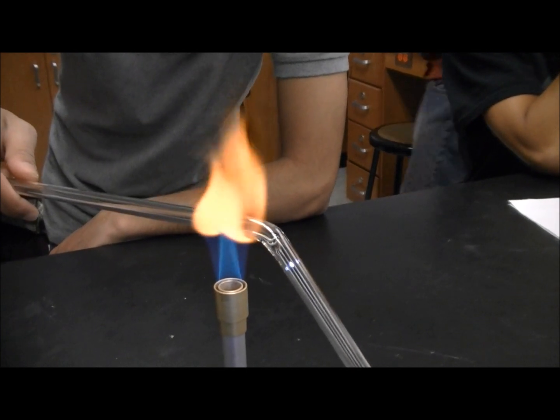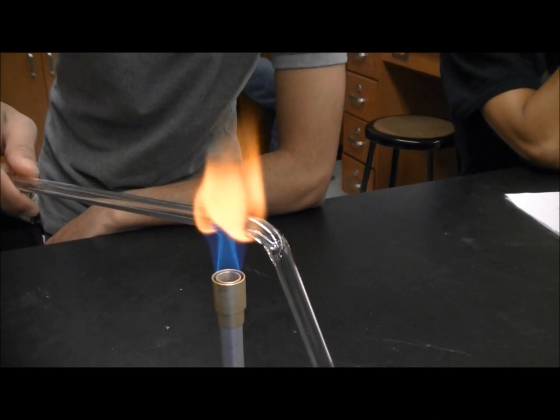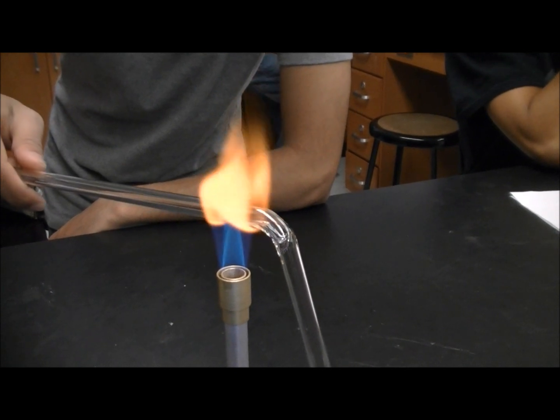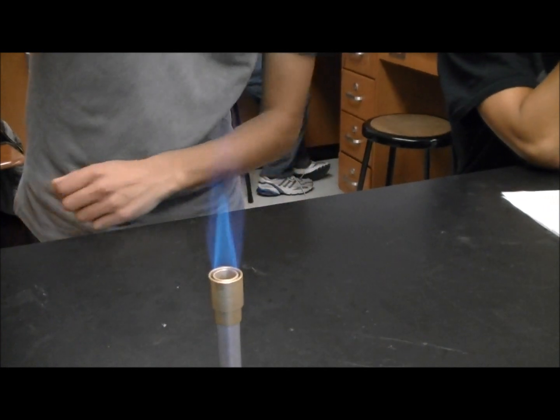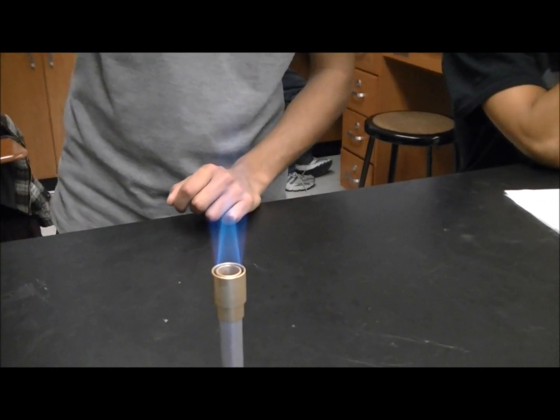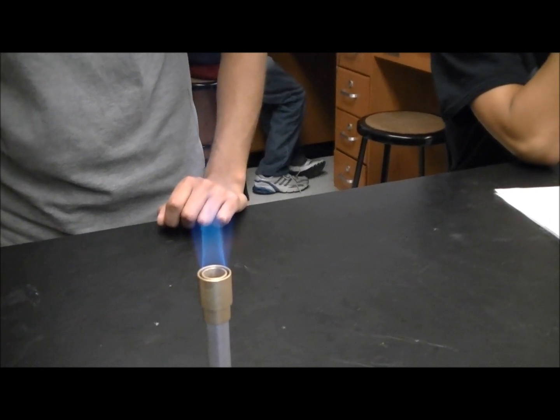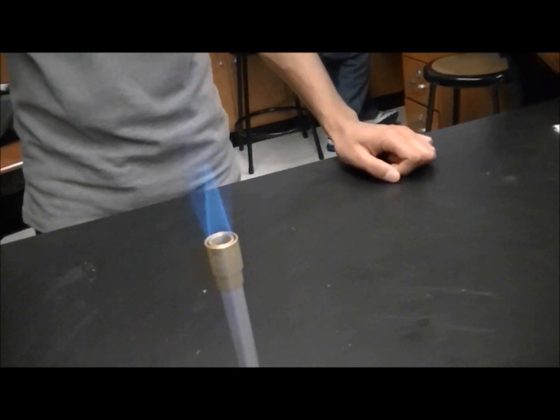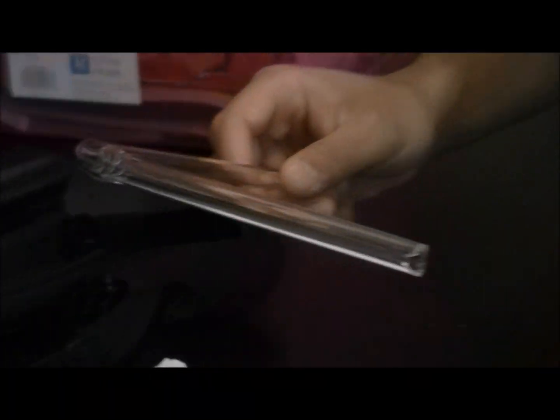Oh, it's bending again. I'm looking at this — it's like an operation. Why don't you hold it closer to that? That's really good. Just hold it. That's why you don't put it — leave the flame. I can smell the paper burning. Pour water on it.